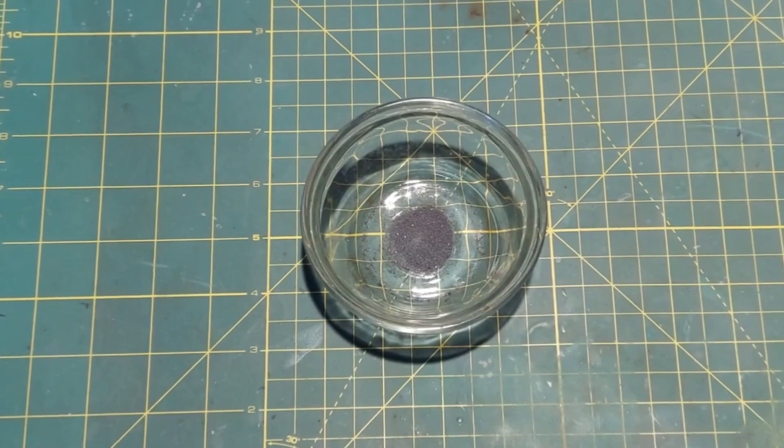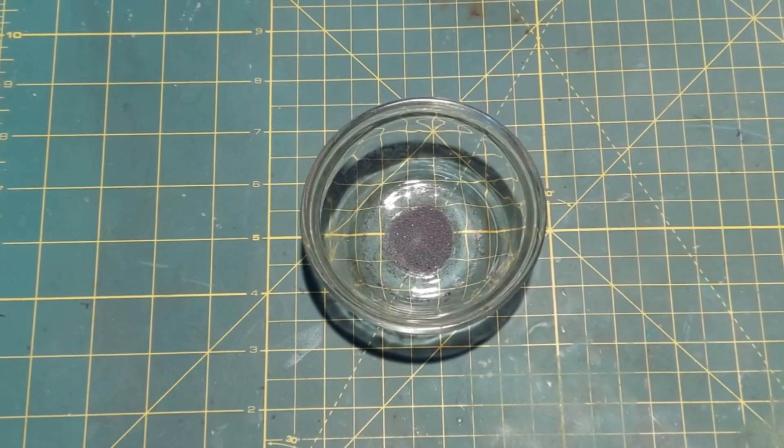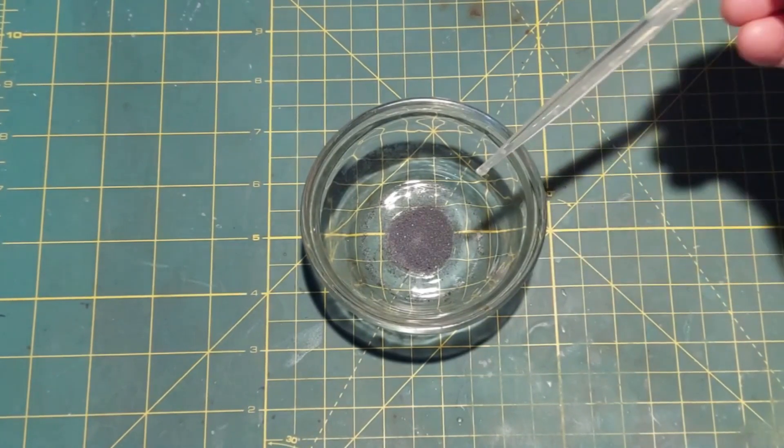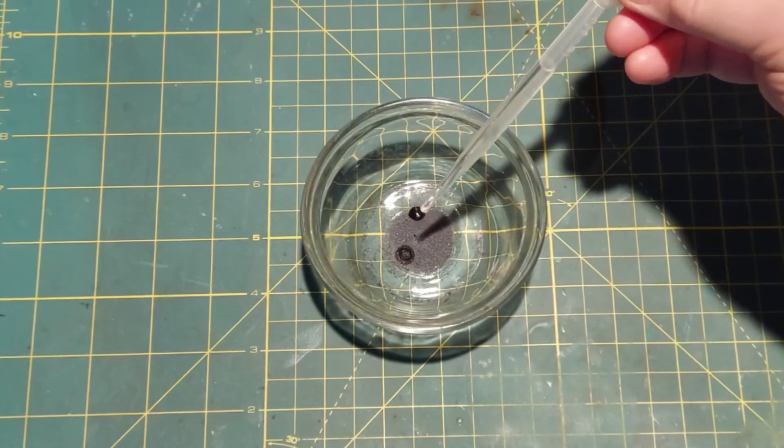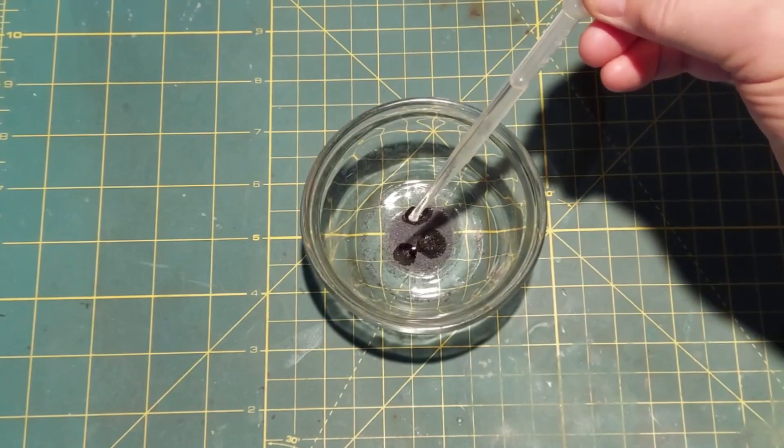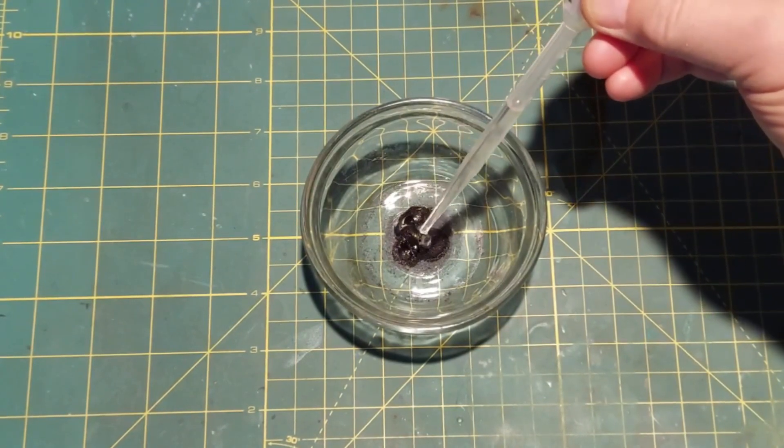Here's our pile of potassium permanganate, and I am going to add to that drop-wise 98% sulfuric acid. You see that absorbs pretty quickly there. It does start to react immediately.